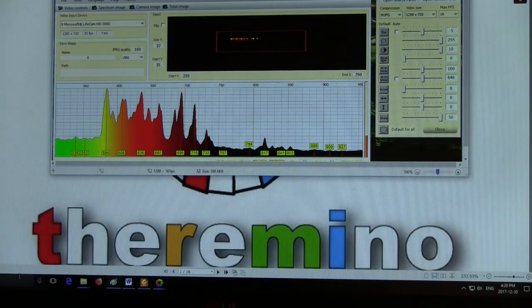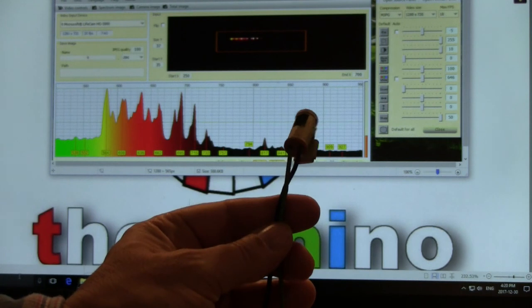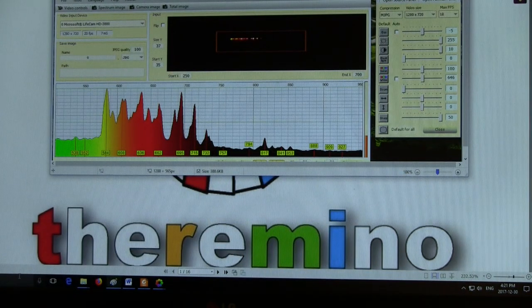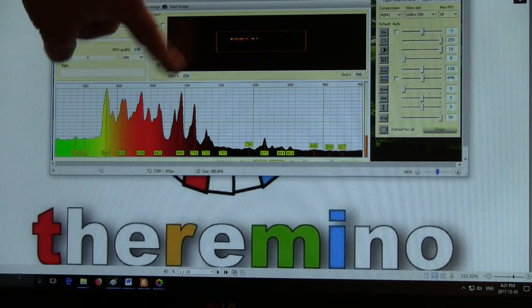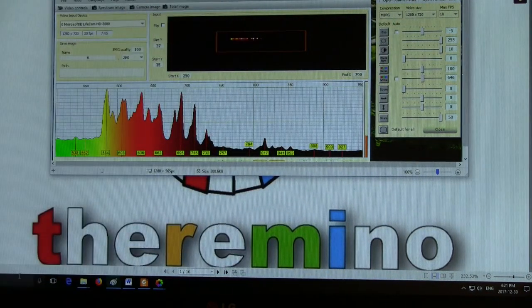One of the things I wanted to look at was the spectrum of a neon bulb, and I happen to have one. This is, I think, an NE2 bulb, just a simple little neon bulb that operates on about 100 volts. And we lit this up and shone it into the slit of the visible IR camera using the HD 3000 webcam. And we got this very nice spectrum here. You can see all of these lines from the neon emission going up into the IR range, so some of them in the 900s. So that was a great spectrum, and we saw good correspondence with what they were reporting for neon emission in the Theremino PDF. So I was pretty happy with that.